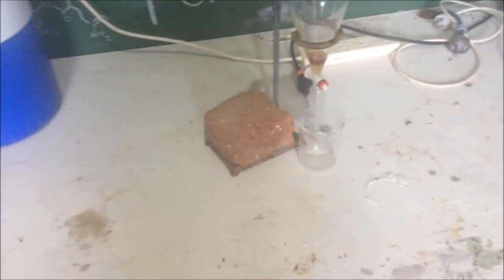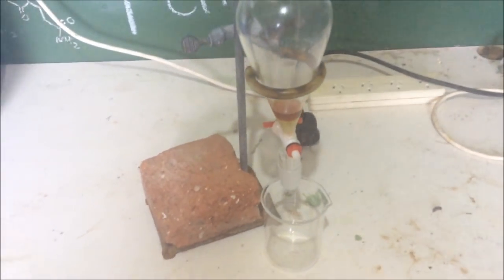it's actually such a small amount, it's going to be difficult to redistill for me because I have such big joint sizes, we've got nothing smaller. But we'll take off this water and just see how much orange stuff we have. So measuring the pH of the water under the benzene there, you can see that it is very basic. It's the green on the filter paper there, which isn't completely unexpected. So I assume that white smoke coming over there was some sort of base. But it's not unreacted terephthalic acid that's subliming off, is what I'm trying to say. I mean, that would be insoluble anyway, but it's very basic.